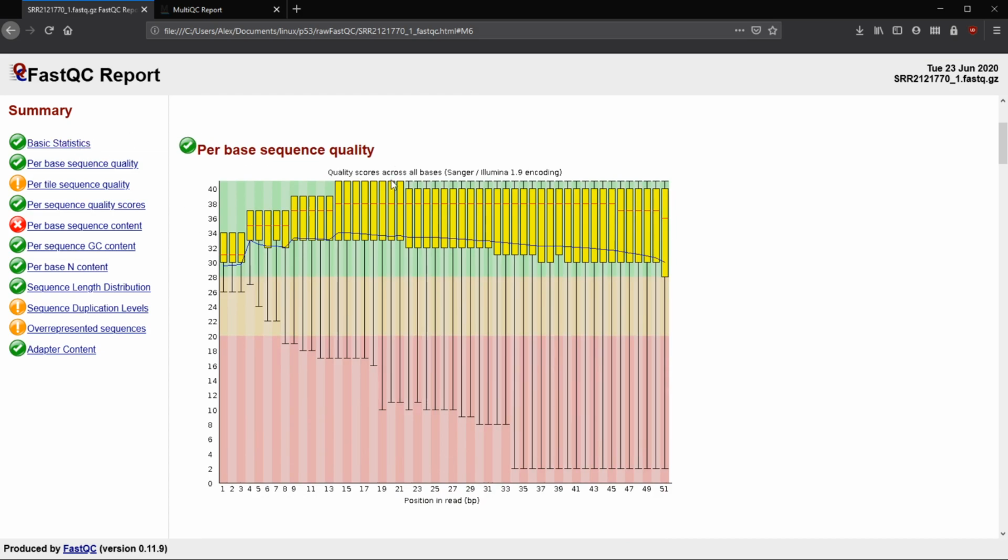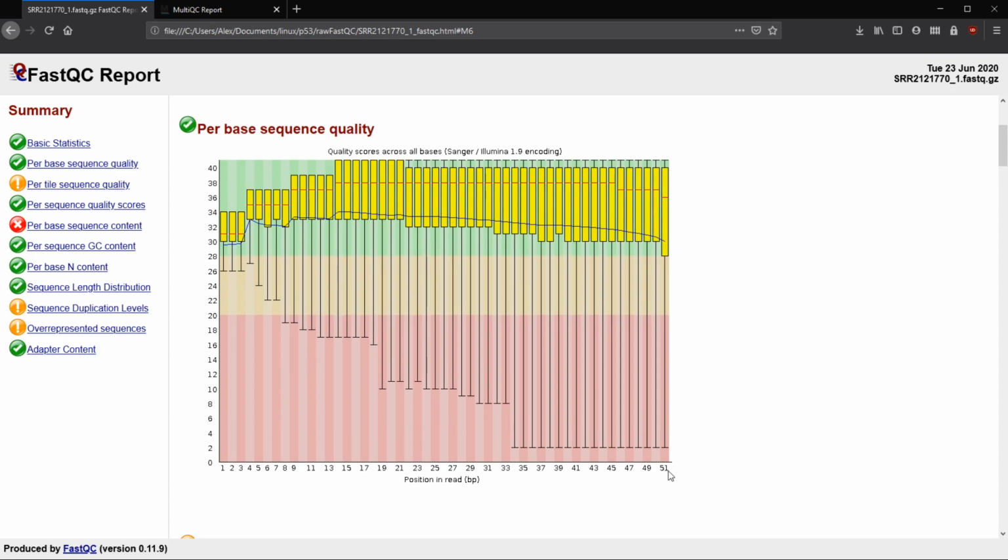So the first one after our base statistics is going to be our per base sequence quality. So remember before we had 51 base pairs is the whole sequence length. So here we have across the bottom each of our base pairs, or each of our bases. And then looking a little bit more at what's happening, the red line here is the median quality of those bases. The yellow box is going to signify the 25th and the 75th percentile. So 50% of the reads are inside that yellow box.